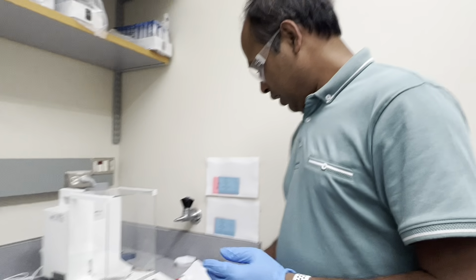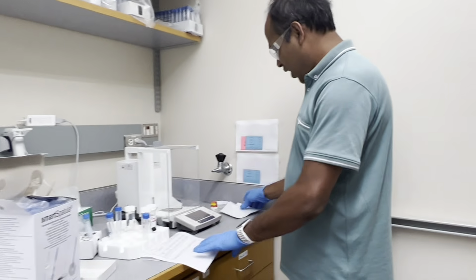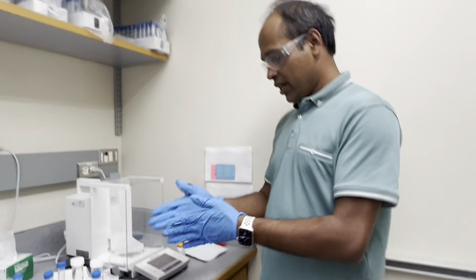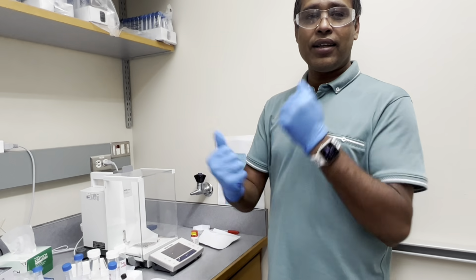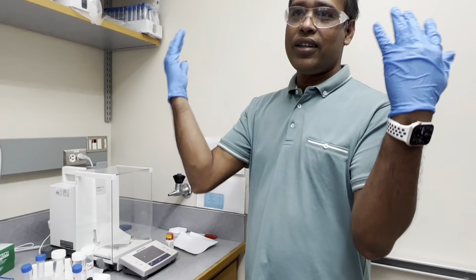Mostly the complicated part is done, like adjusting what solvent and solution. Okay. So now we are going to measure the solid part. We'll take this in the Falcon tube and add the liquid according to the adjusted calculation, and then the things will happen.